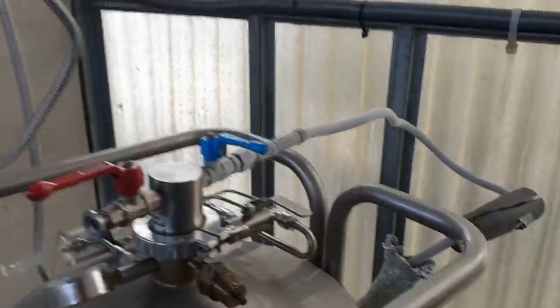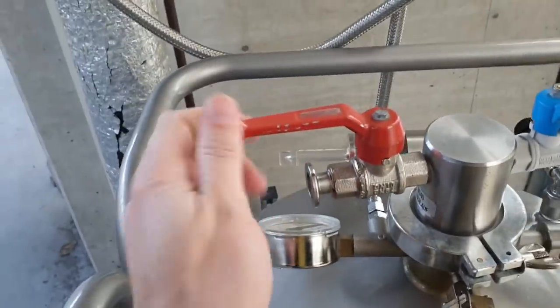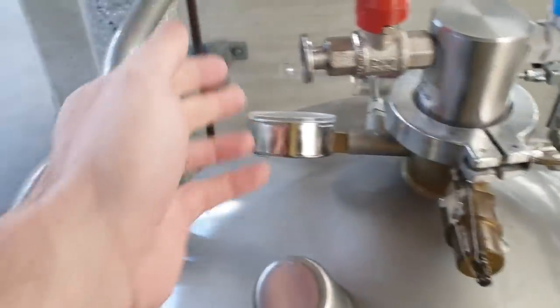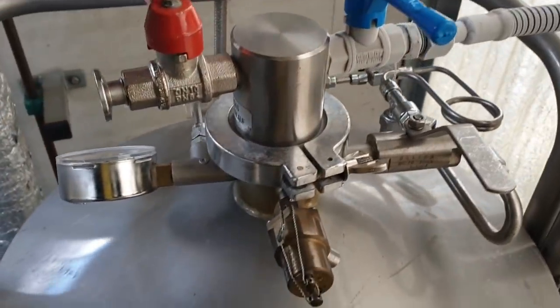So this is a 200-odd litre liquid nitrogen dewar, which is now empty. That's the pressure line. Normally it would come out here, but if you open that one and you get almost no pressure, this thing's almost empty. So I'm going to fill it.